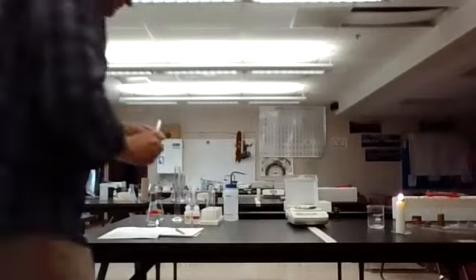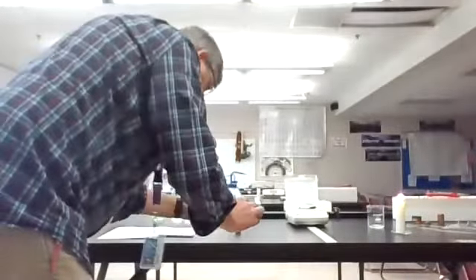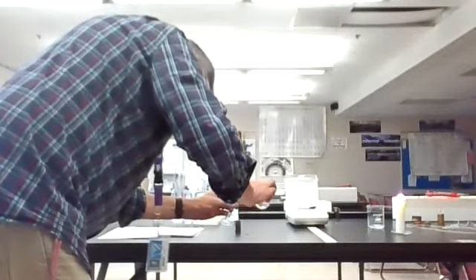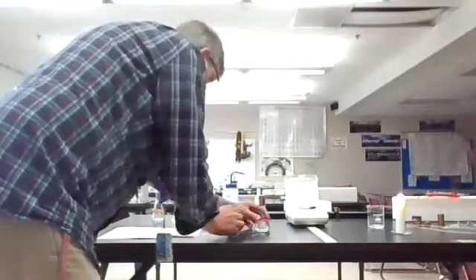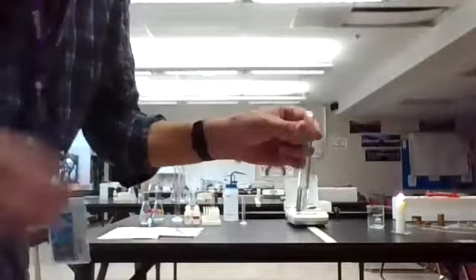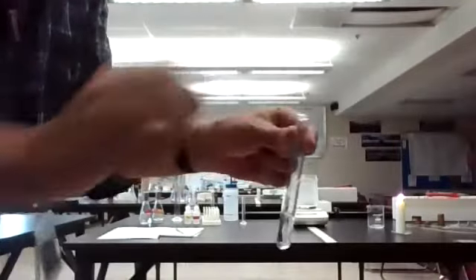This is a 5 milliliter graduated cylinder. So I'm just going to fill this all the way up to the top. And to tell the truth, for this lab, it doesn't matter if we're exact. We're pretty close. I'm slightly over, but that's going to work for what we need to do. So I'm going to put this in my test tube, which I already cleaned out, by the way. And it looks something like this. Now, what's going to happen is I'm going to put my piece of ribbon in here, and I want you to watch and see what happens, and you record your results.